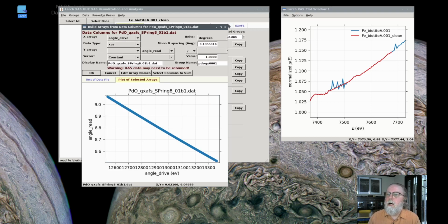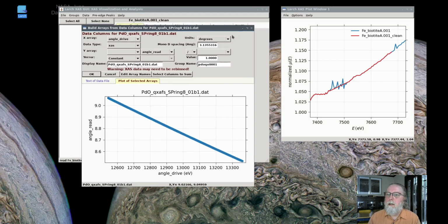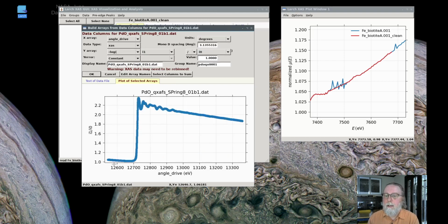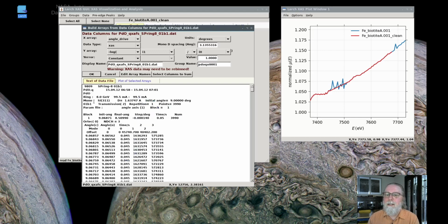It treats raw data from other file formats. You can read that in, but it doesn't then apply any of the normal XAFS treatments to the data. So we can read that in, and now if I say I1 over I0 and minus log, that actually looks like XAFS data. It looks correct, but it's not palladium XAFS data because the palladium edge is more like 24 keV. That's because this assumed so far that the mono d-spacing of 3.13 is appropriate for silicon 111, but in fact this used, we can read it here, which is really nice, 1.637 for silicon 311.